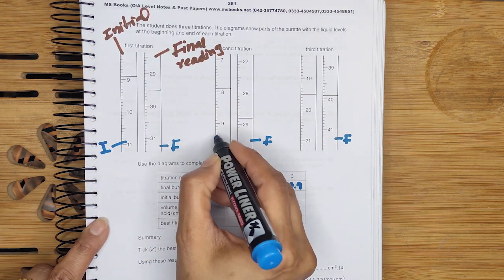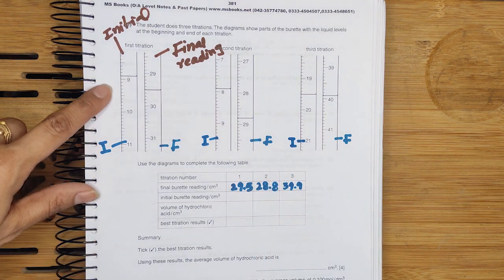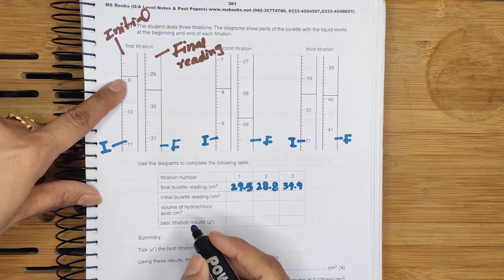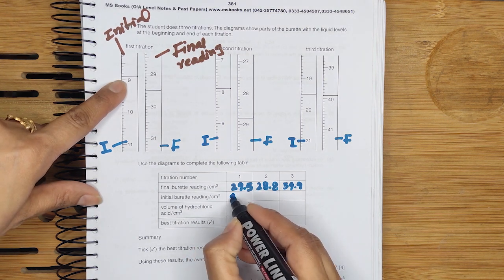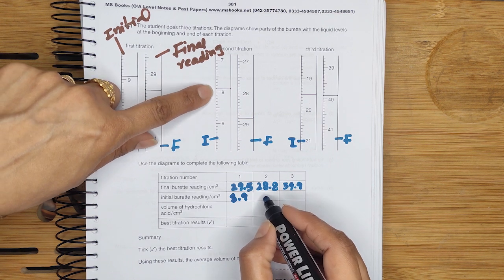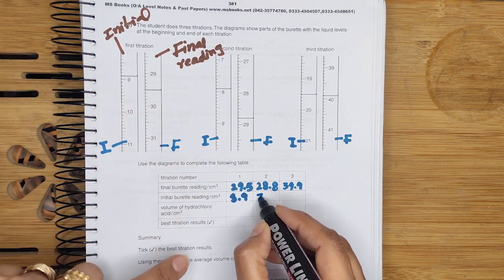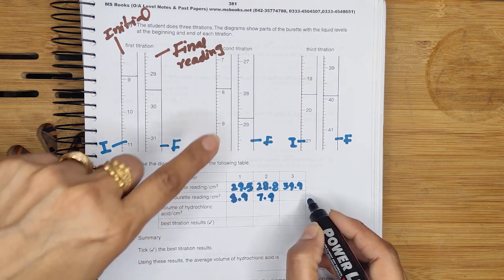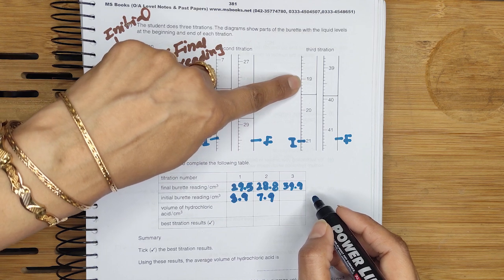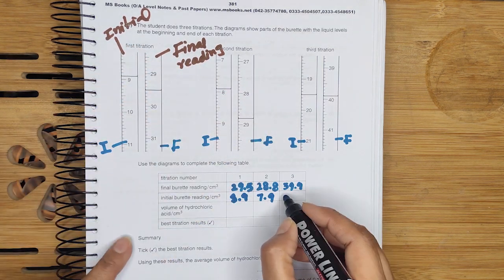Next, the initial reading — I stands for initial reading. You must know the initial reading. The first initial reading is 8.9. The second initial reading is 7.9. The third initial reading is 19.1, 2, 3, 4, 5 — that is 19.5.